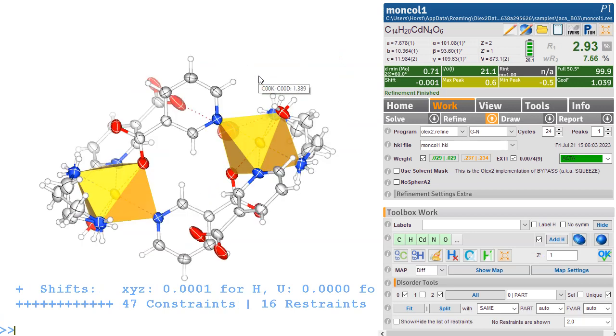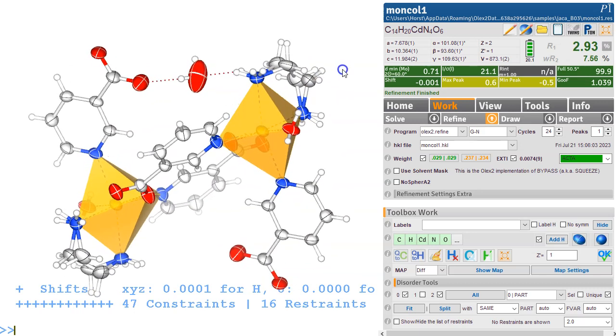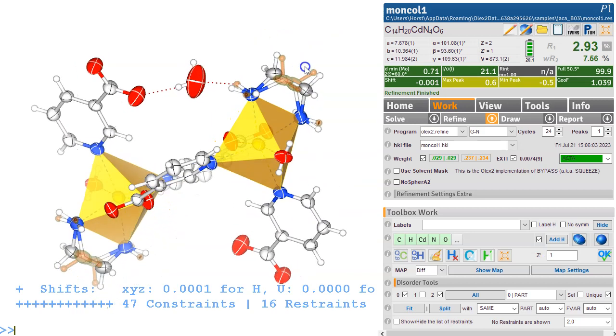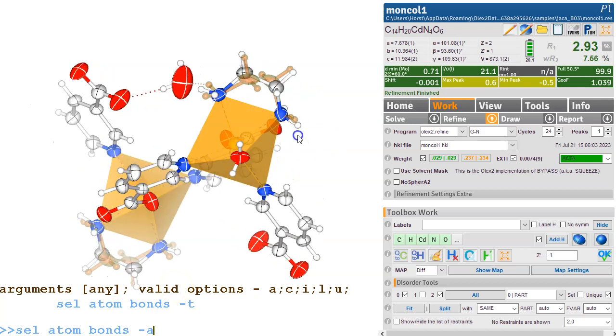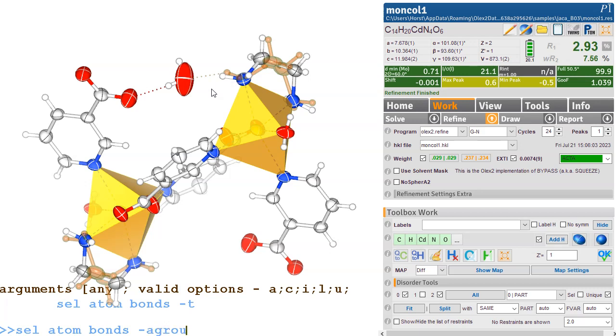Final grow, so we see the whole grown thing, and now you might want to hide the disorder. We can go sel part 2, so we're selecting everything in part 2. Sel atom bonds, that selects all the bonds to the atoms. So all the bonds that are involved in the disorder should be selected, but it didn't select those ones. I think there was, is it -T? No, -A. Yes, -A. So sel atom bonds -A selects all of the connected bonds, and now we can group them.